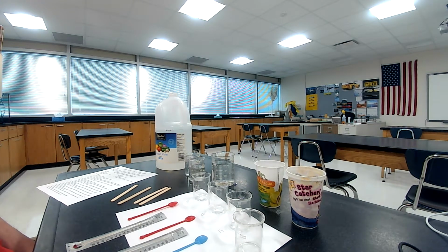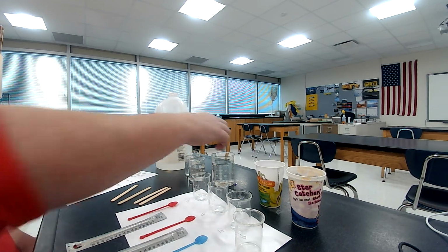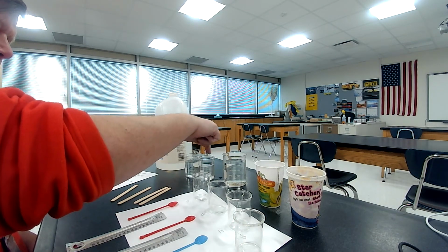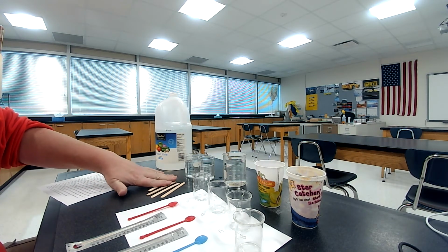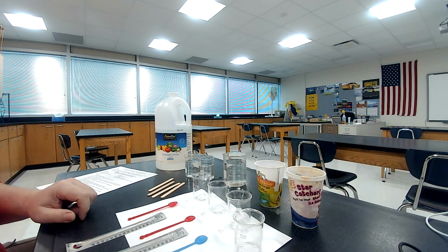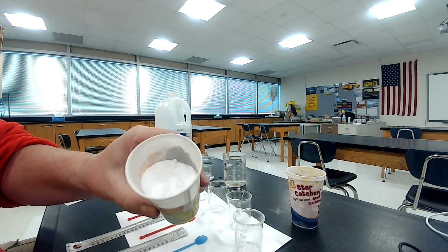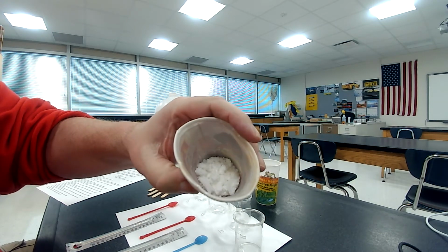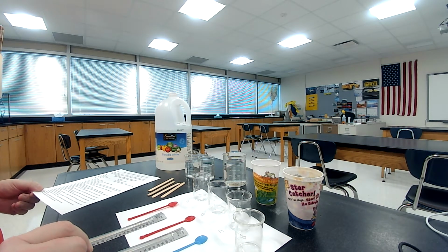So here's what I have in front of me today. I have 4 beakers that are labeled A, B, C, and D. I have some tap water here at room temperature. Same thing in these 2 beakers. I'm going to use these two for my rinsing stations. I have some stir sticks, which are over here. I've got some vinegar, also known as acetic acid. And I have in these cups right here, this real fine grained one, baking soda. And in here, I have calcium chloride. That's what you put on your sidewalks to melt it. Okay, so those are all the materials I need.